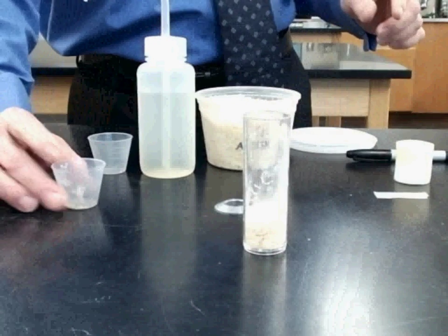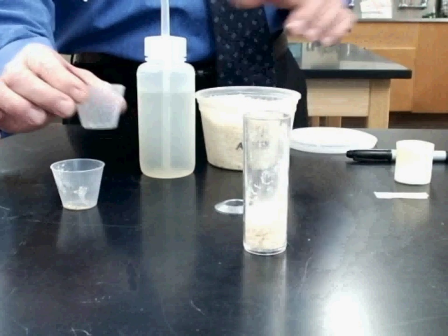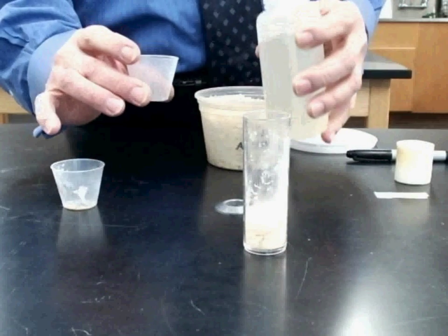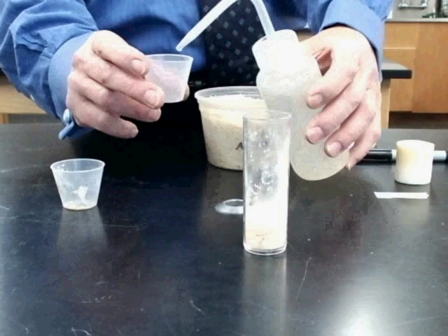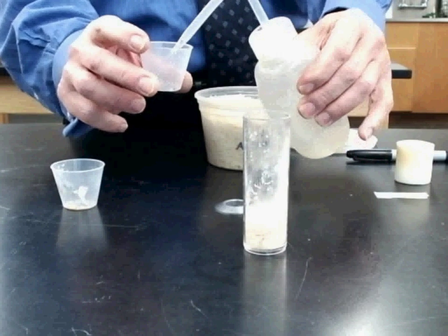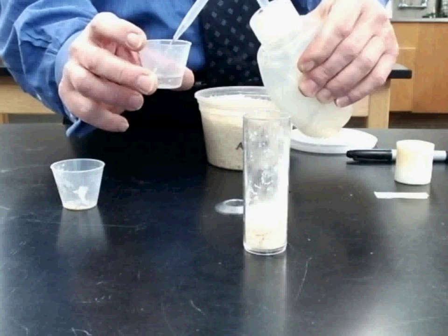Now, you're going to take a different measuring cup, a clean one, and you're going to measure out an equal volume of water. About 20 to 30 mLs, depending on how much media you use.